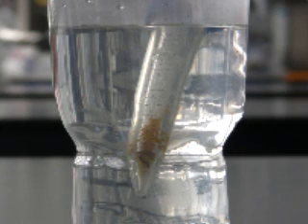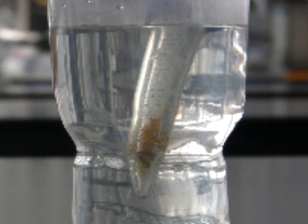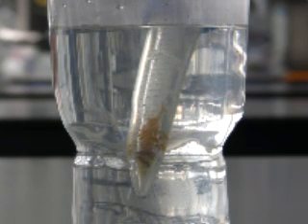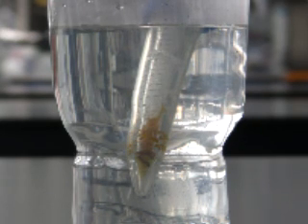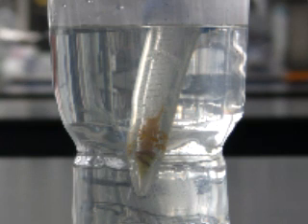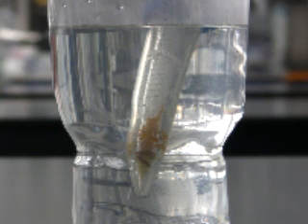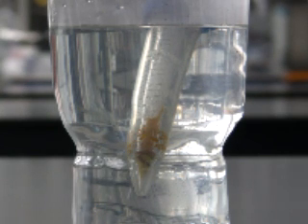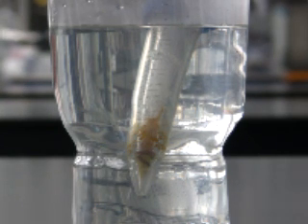However, because the tube is sealed, pressure is allowed to build up as the carbon dioxide sublimes. Eventually the pressure increases high enough that at this temperature the carbon dioxide is able to form a liquid.